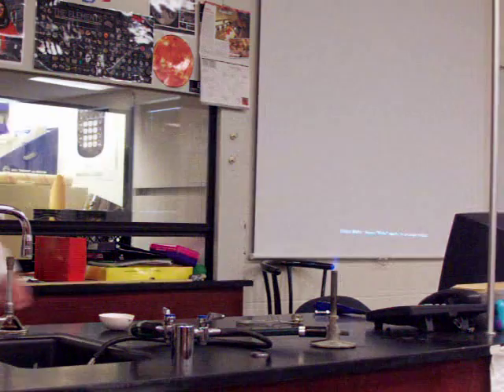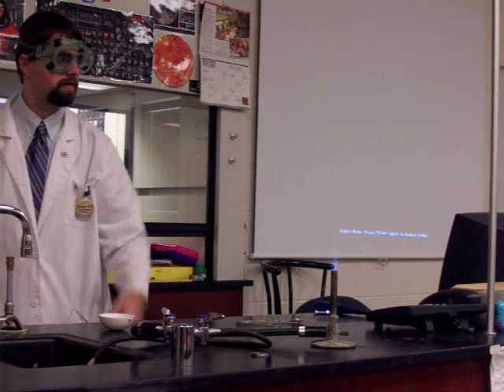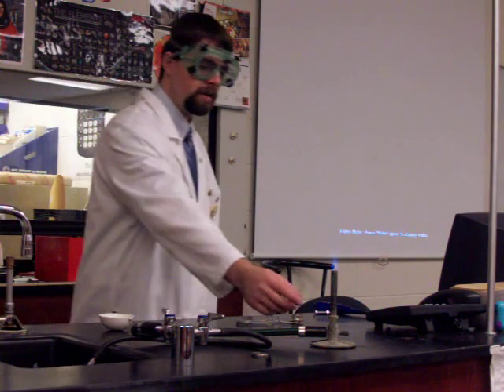If that happens, just turn the gas back a little bit. And you can do that either here or on some burners—I'm going to turn the lights here again. Some burners have this knob down here. That knob there adjusts the amount of gas flowing in.